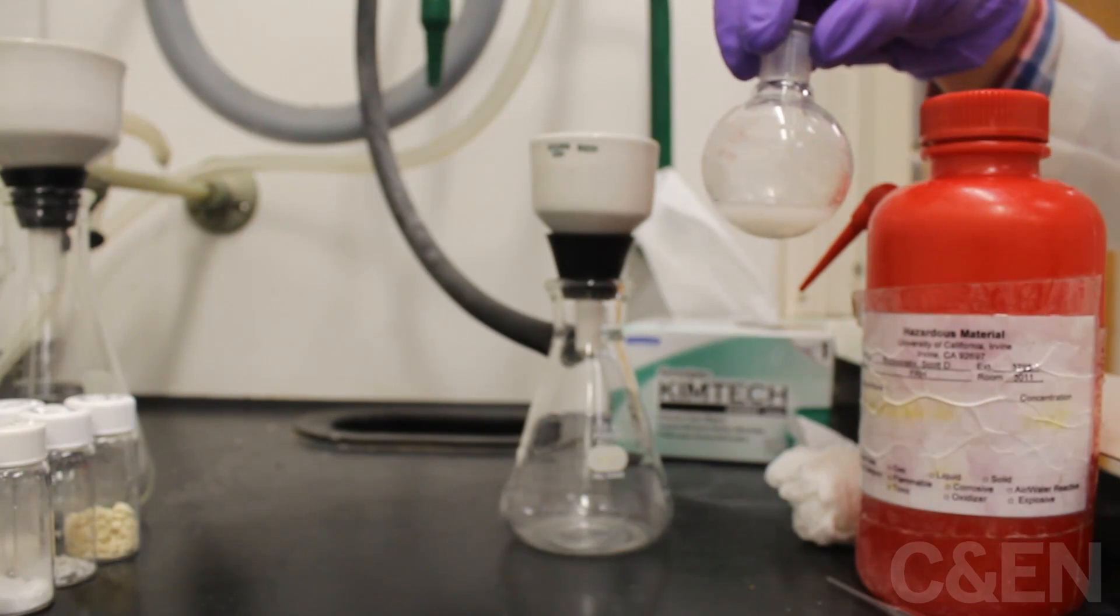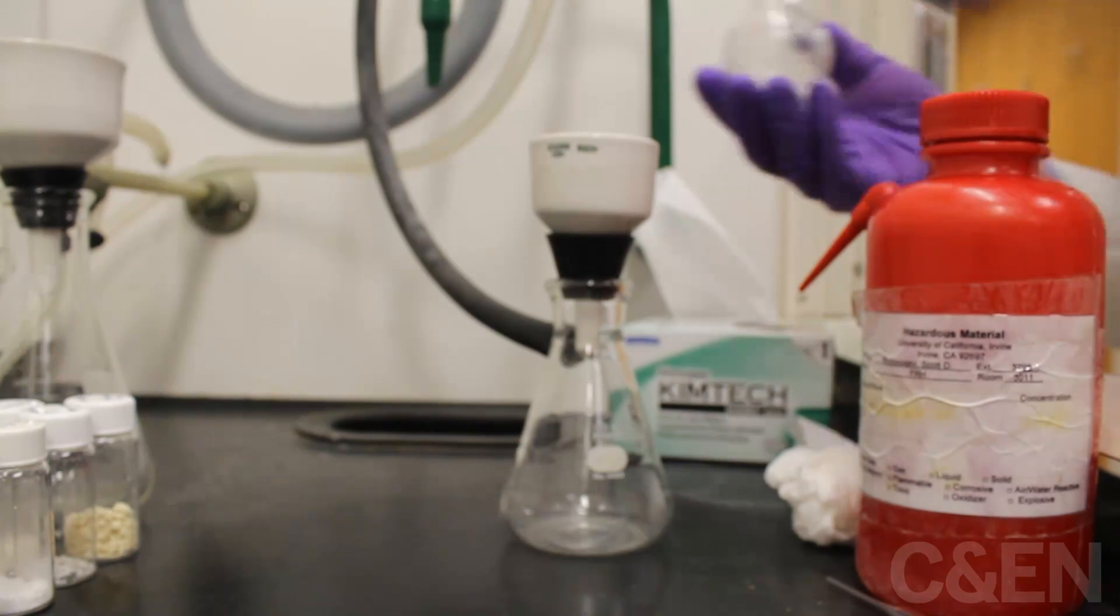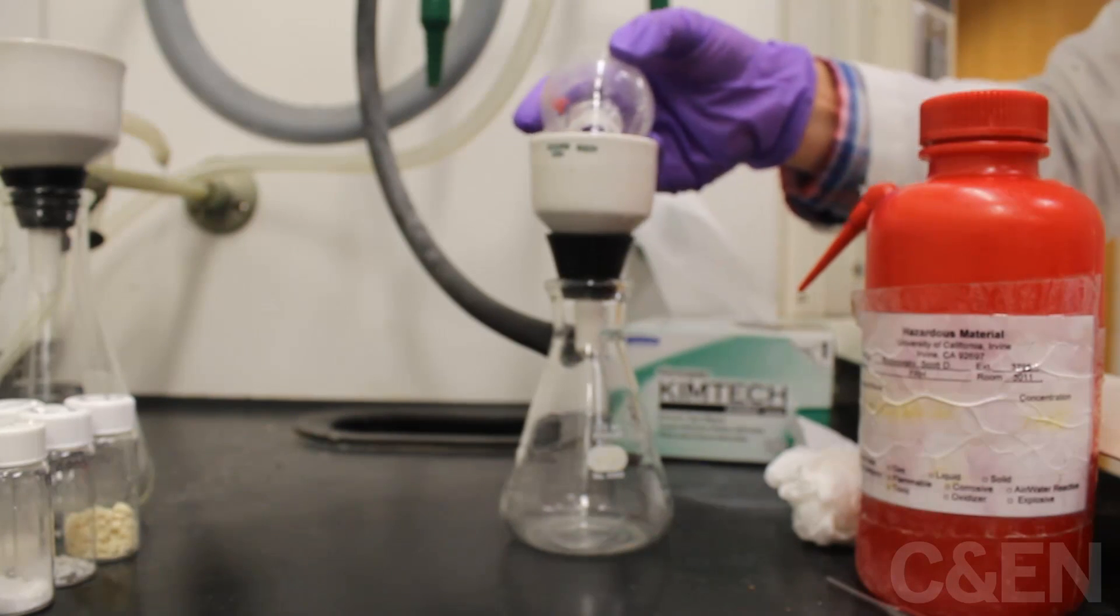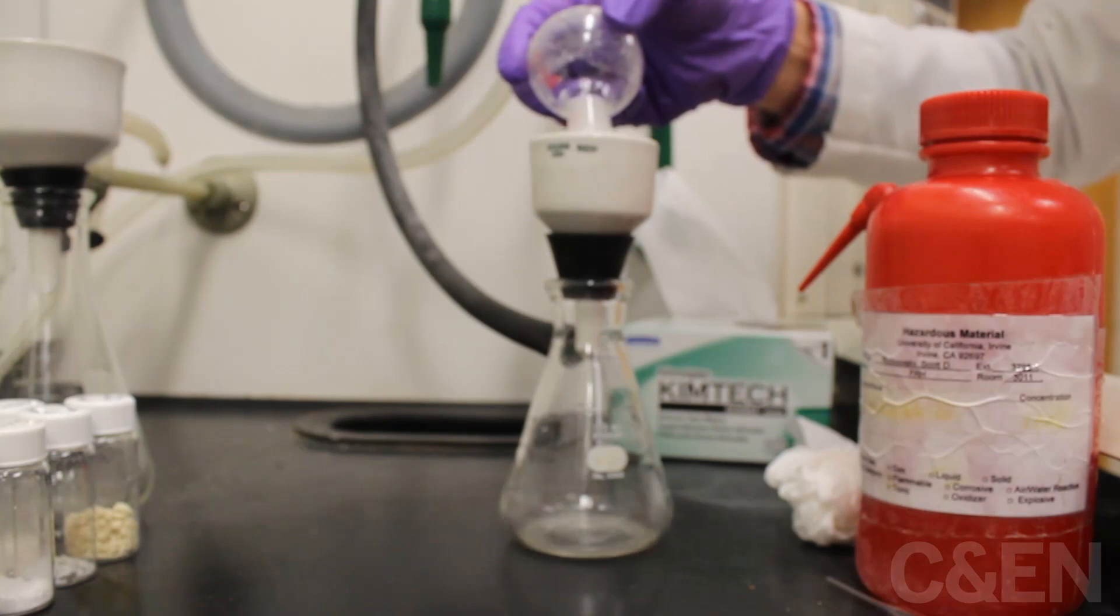The DABO boronate can then be filtered directly. It gives you a really nice white solid, and this can be used in Suzuki-Miyaura couplings.